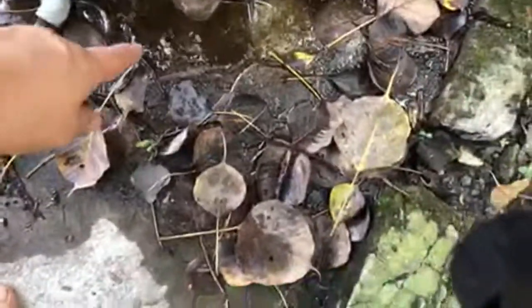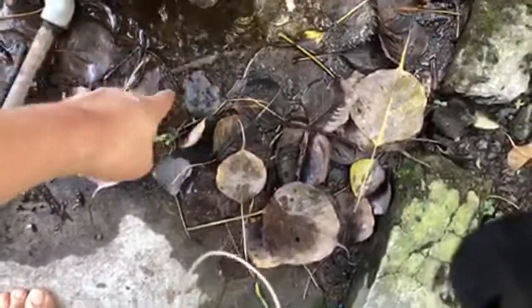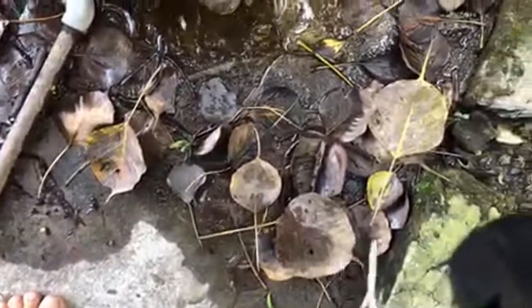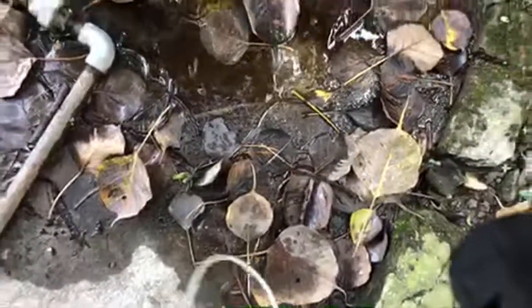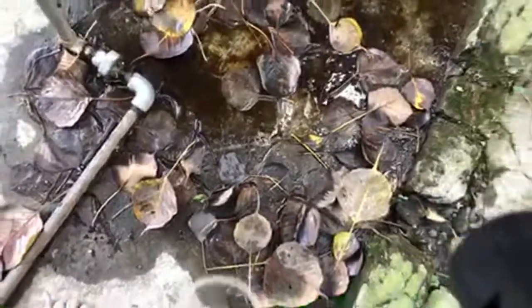What I have done is I have gathered some sample from a twig. You can trace out this white line. There was a twig here a while back. I've just taken that sample and tapped it on the slide, and I found something promising already. We'll proceed on to the sample and see what we have.